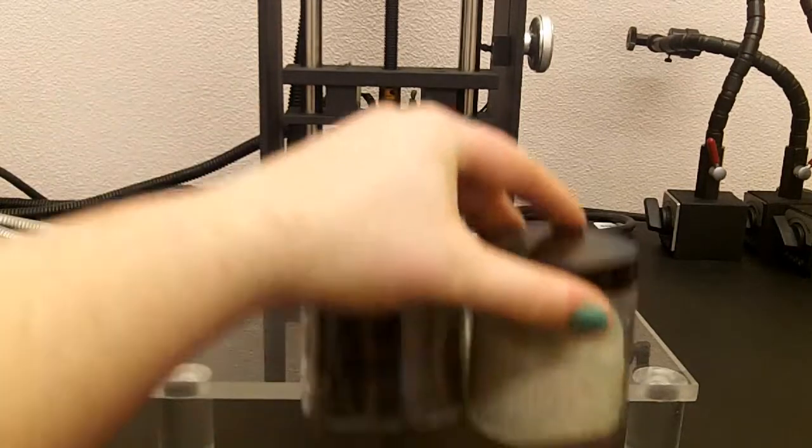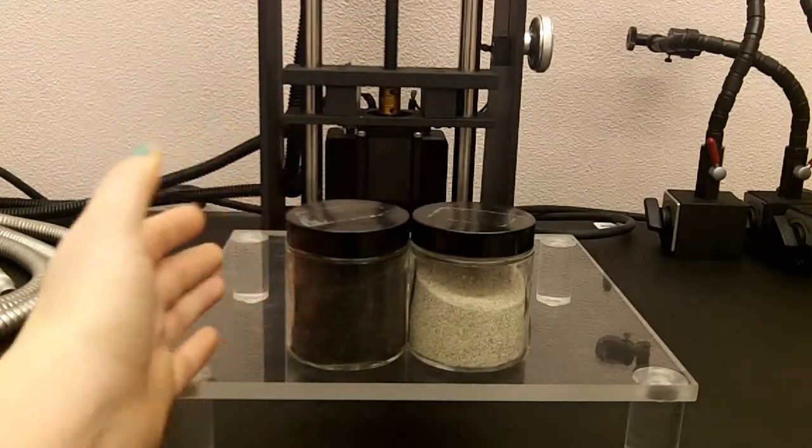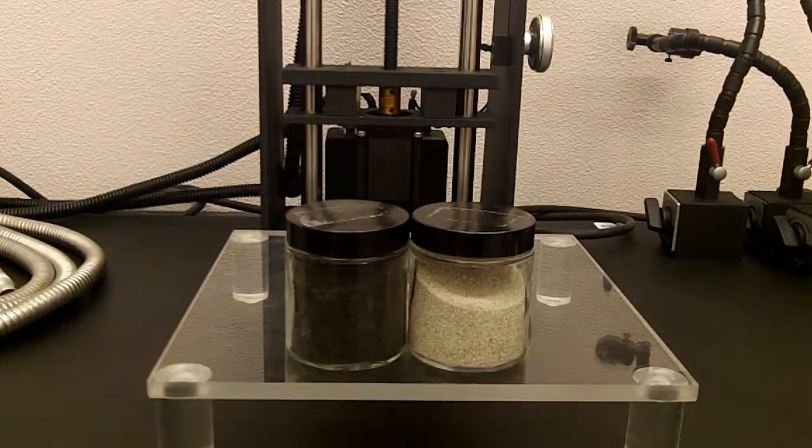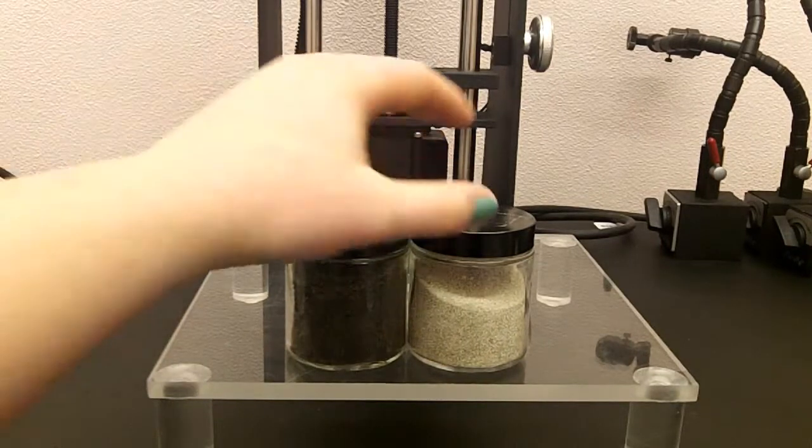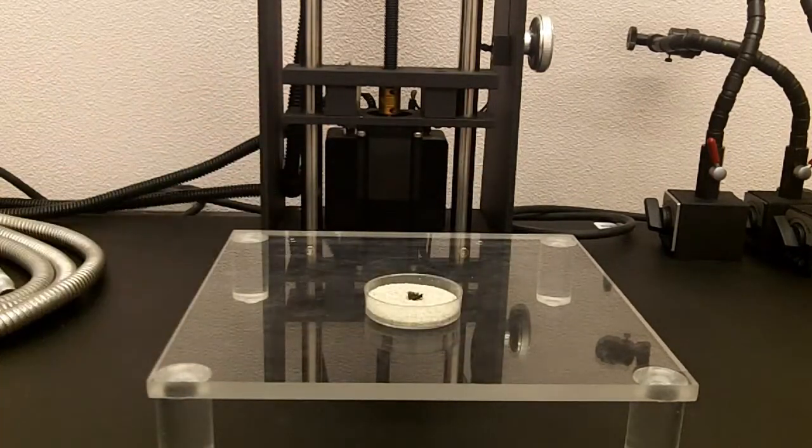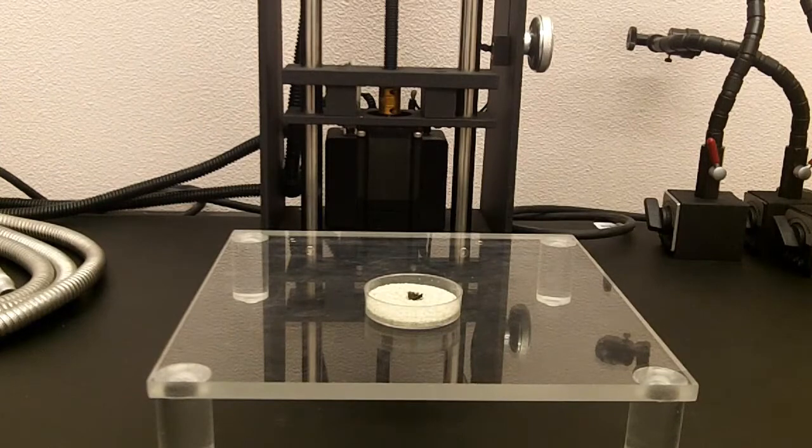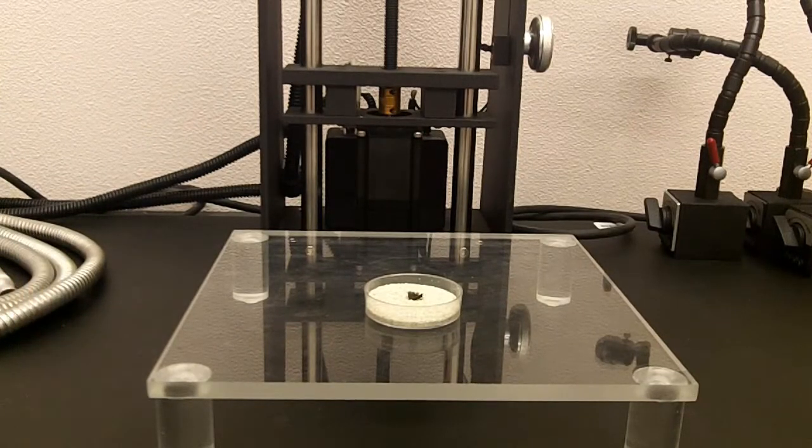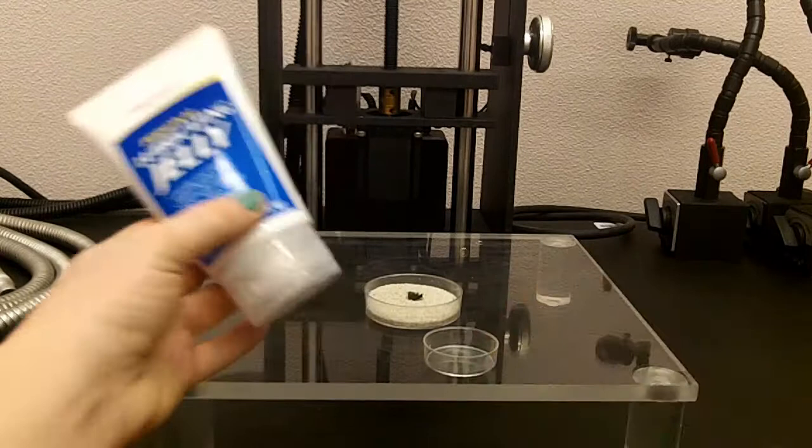You can use either sand, and here I have a black sand and a white sand. Typically I use the white sand just because it creates less shadow. And then another technique is to use gel and ethanol.